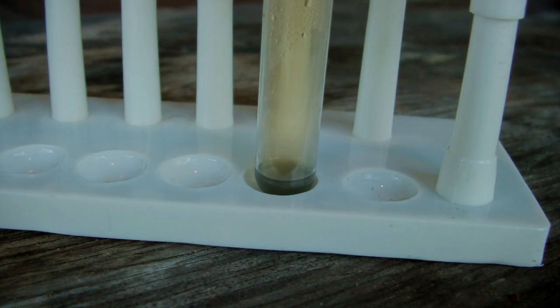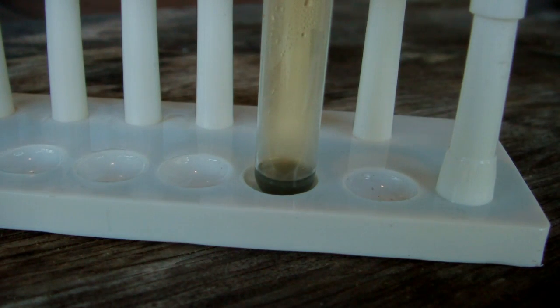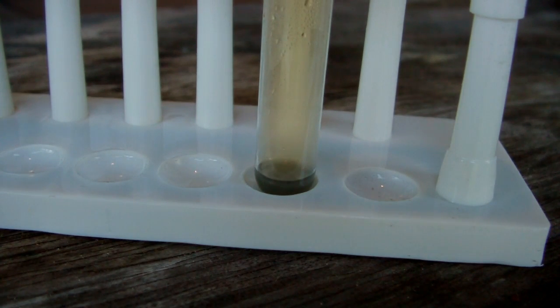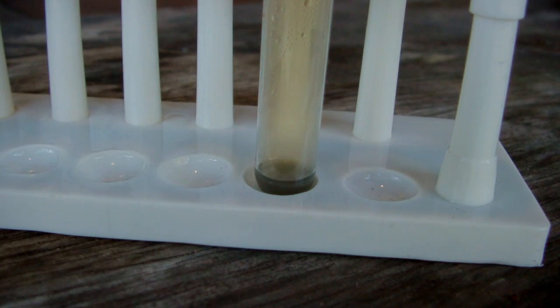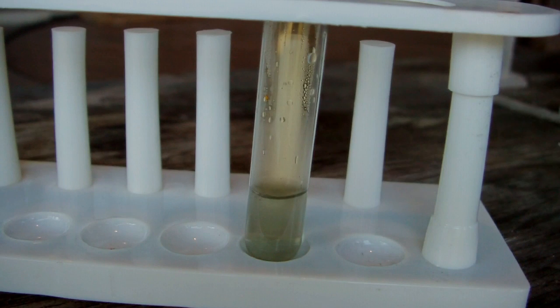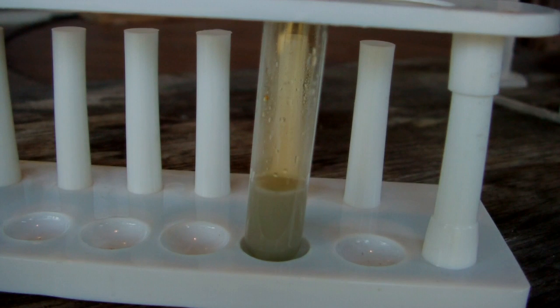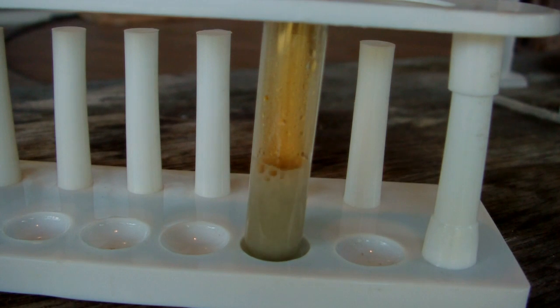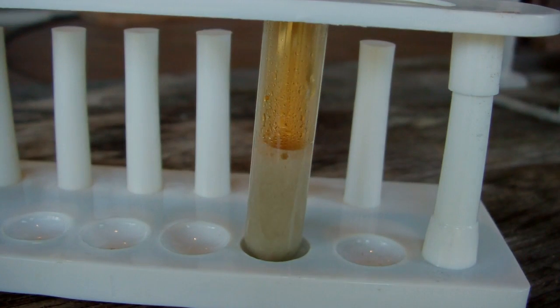Since that produced a bit of a hellish reaction with all kinds of nitrogen dioxide and a ton of heat, what I did for the rest of my acid was I diluted it by half. I need a total of 1.6 milliliters of my 16 molar acid to react away the rest of my terbium, so I diluted that to about 2.5 milliliters. I'll add the extra acid to this, then add the rest of the pieces of the terbium. You can see, again, we get quite a reaction, and I think I'll be adding these in fairly slowly.